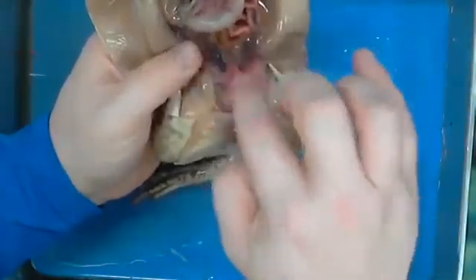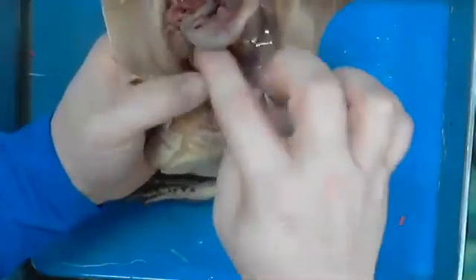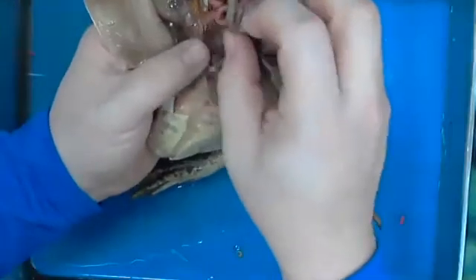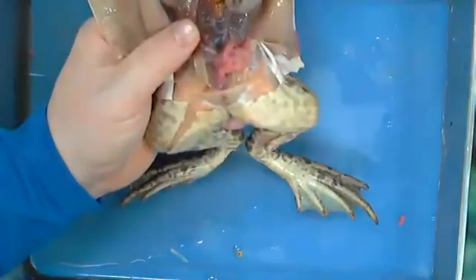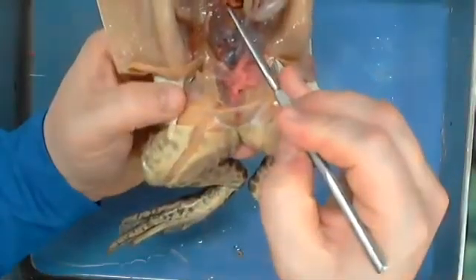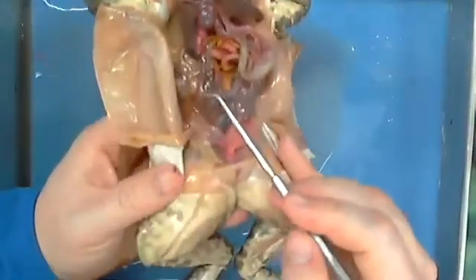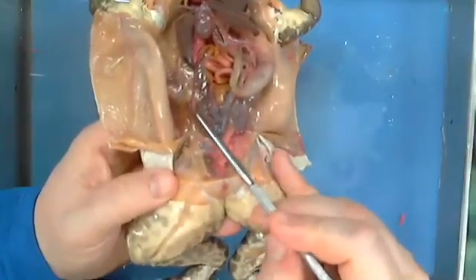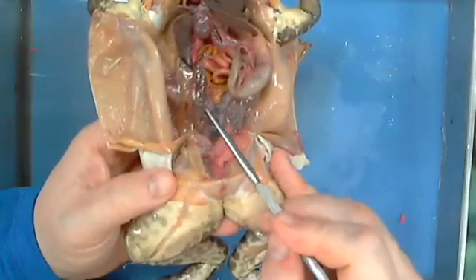So notice, if you will, I'm going to pull it to this side. There is this large brown shaped object that sits from here. Oh, I'm off the screen. Sorry. That sits from here to here. And there happens to be 2 of them. Here's one, a kidney.